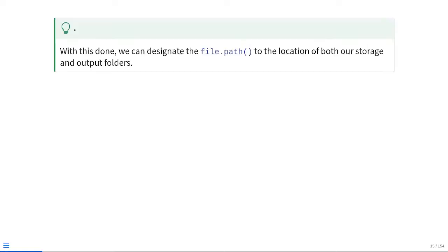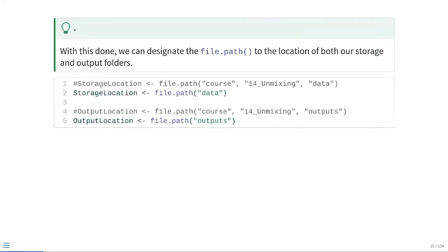Once this is done, we just need to designate a file path to the location of both our storage and our output folders. As we've seen in previous weeks, we're providing the full file path between our working directory and that particular folder. In this case, if you're following the course's weekly organization scheme, it's going to be week 14, and within that folder you'll have a subfolder called data and a subfolder called outputs. So you're just doing file path to the data, saving that to the object storage location, then file path to outputs, saving that as the output location.